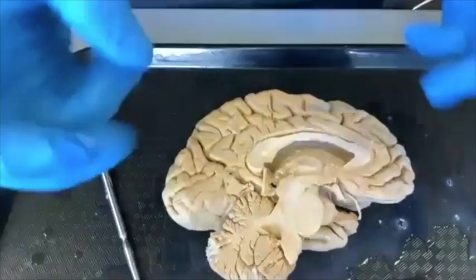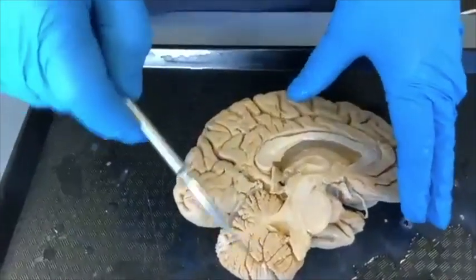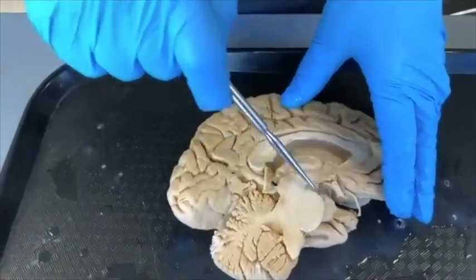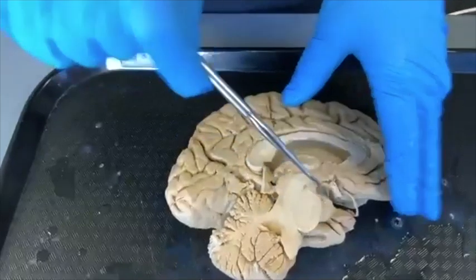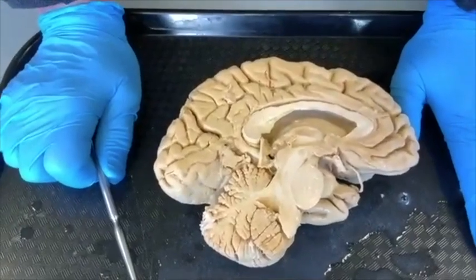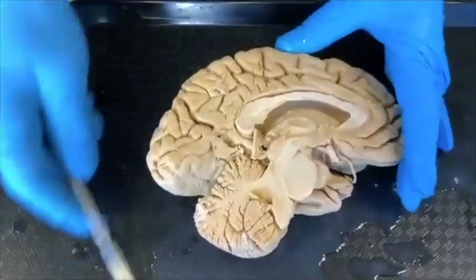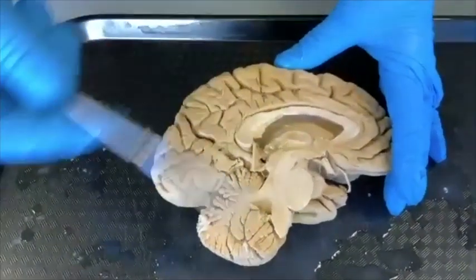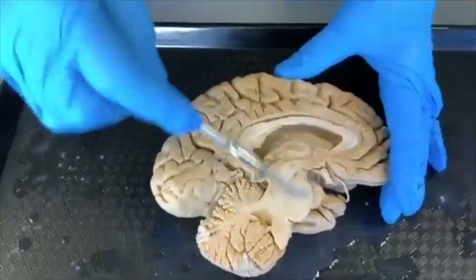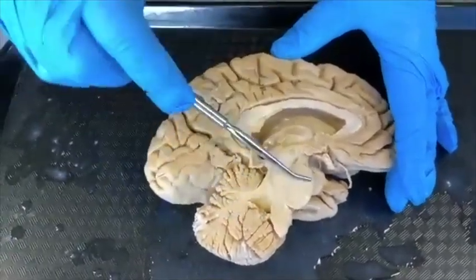This big circle is called the basis pontis — the bottom of the pons that is connected to the cerebellum. The more fine coordinated movements you can make, the larger the cerebellum; and if the cerebellum grows, the basis pontis must also grow. There are about nine people known to have cerebellar agenesis — a cerebellum that never developed — and they also don't have a basis pontis. It's flat in their case.